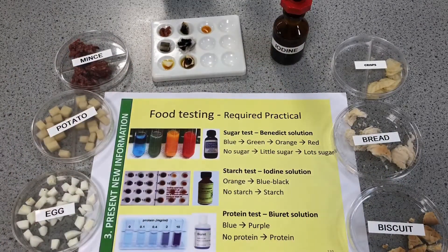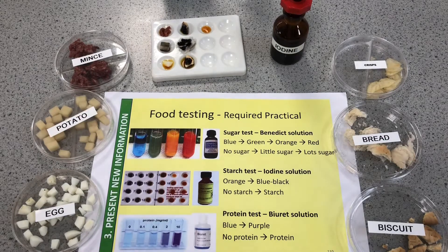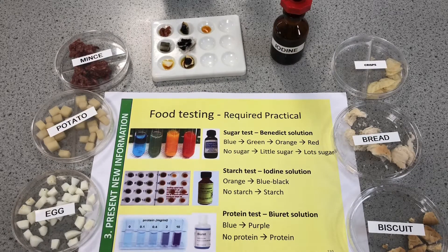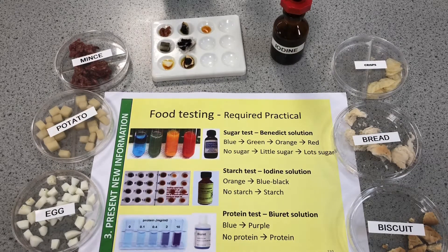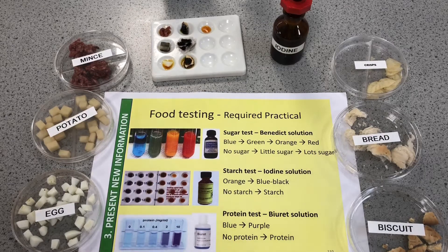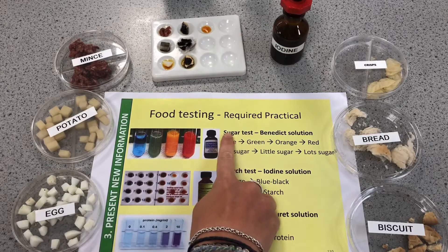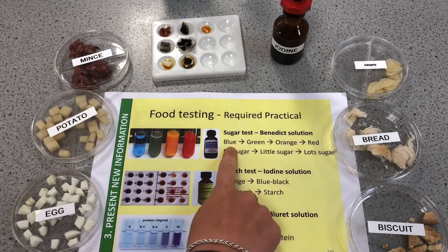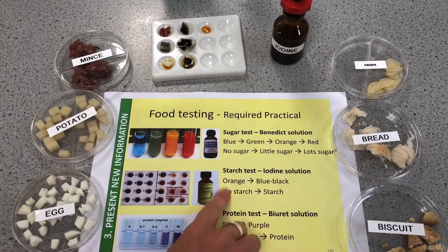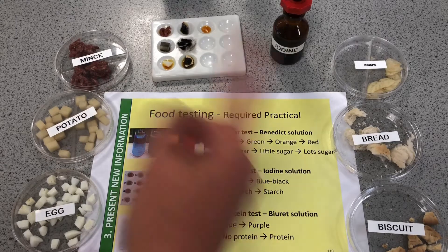That's our starch test — it tends to be the one people remember best because we use iodine solution so much. This could easily be a six-mark question: describe the tests, the chemicals you would use, and the results you might get for various food groups. You'd get a mark for saying the sugar test uses Benedict's solution then the colors and what they mean; starch test uses iodine solution, then orange for no starch and blue-black for starch.